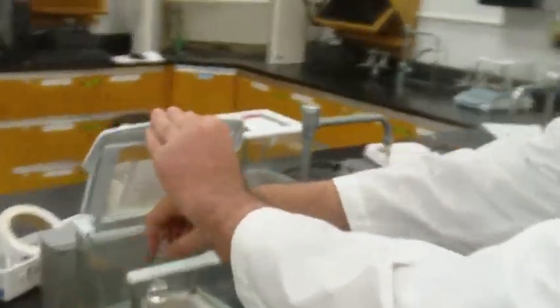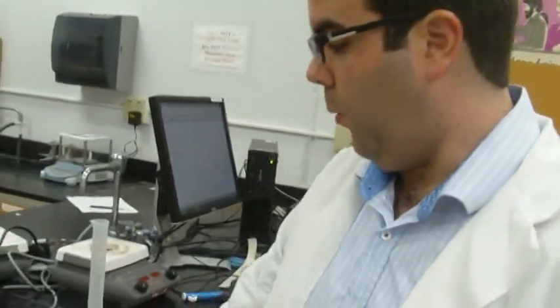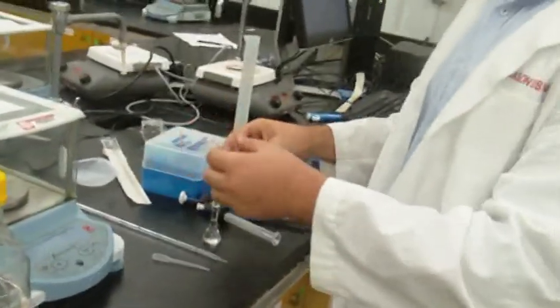We will be using this volumetric flask for measuring out the 10 milliliters of solution. To weigh out the copper sulfate, we will be using this balance, putting a weigh boat on it, taring it, and then weighing out a gram of copper sulfate. Then we will take some water. So you're going to put that copper sulfate into here?